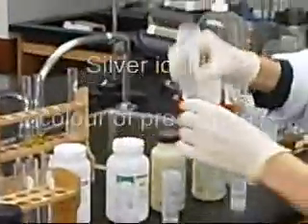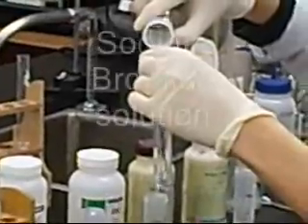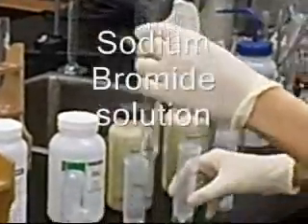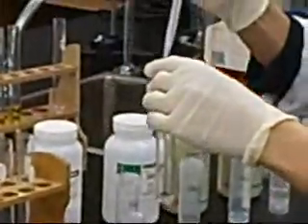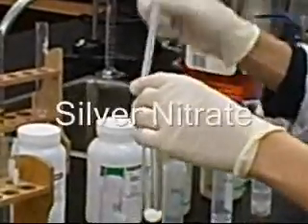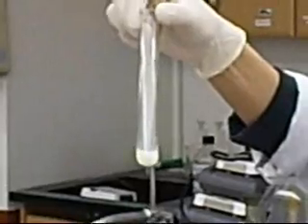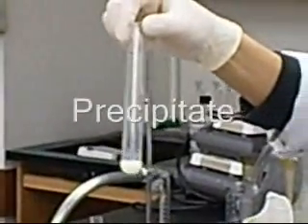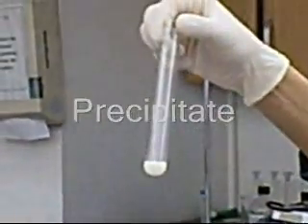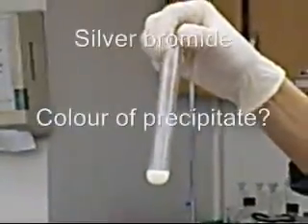Next, sodium bromide solution. Add a few drops of silver nitrate. A precipitate forms — silver bromide. Observe the color of the precipitate.